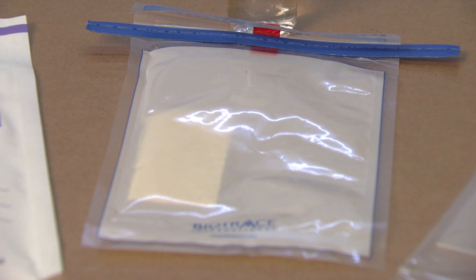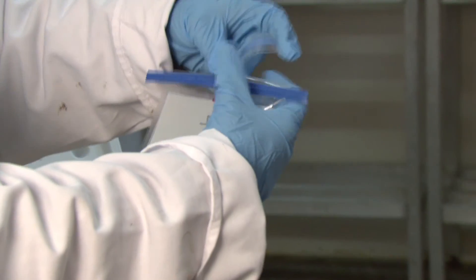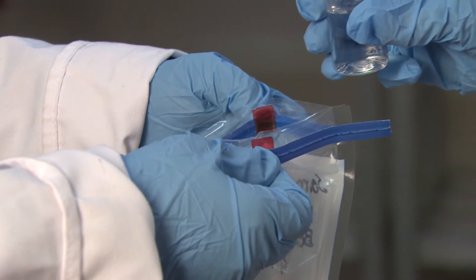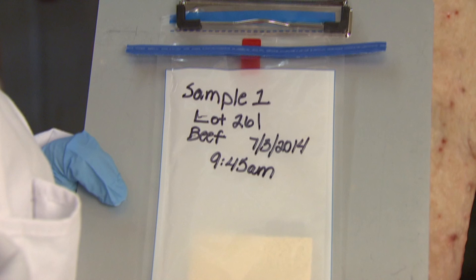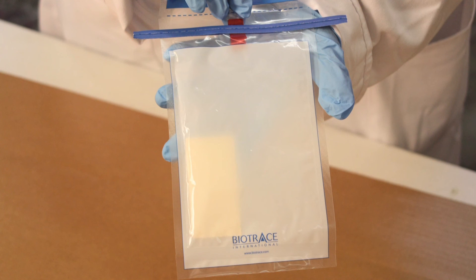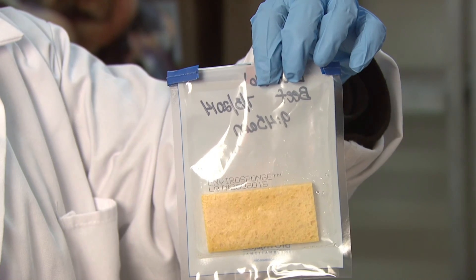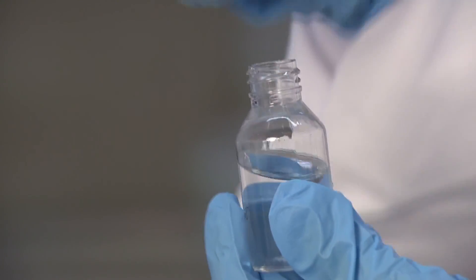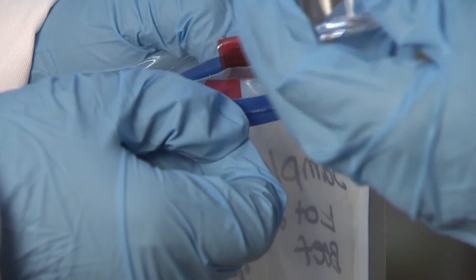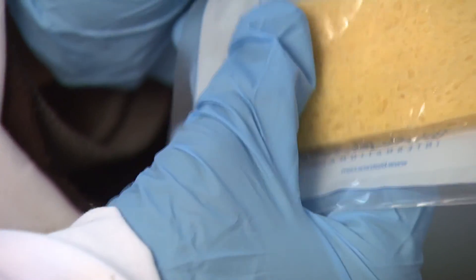The first step in the sampling procedure is to open the bag containing the sterile sponge. Hold the bag by the wire closure and tear off the clear perforated strip at the top of the bag. To keep the bag sterile, avoid touching the inside. Pull on the tabs on either side of the top of the bag using aseptic procedures. If starting with a dry sterile sponge, add sampling buffer to hydrate it: pour approximately 10 ml of the sterile buffer solution into the sponge bag, massage the outside until fully hydrated, then close the bag. If the sponge is pre-hydrated, skip this step.